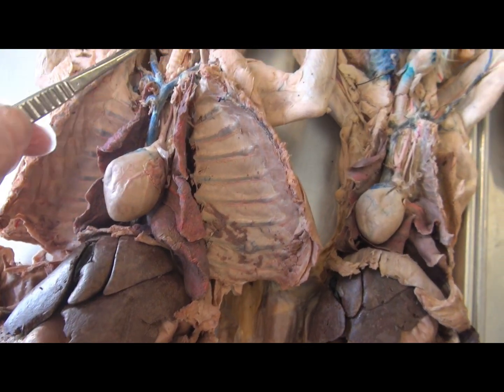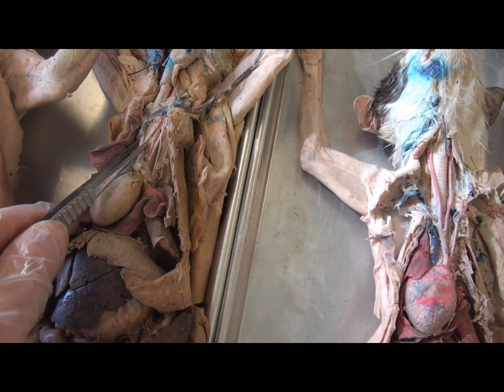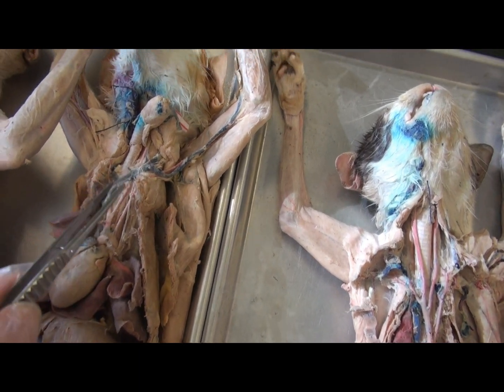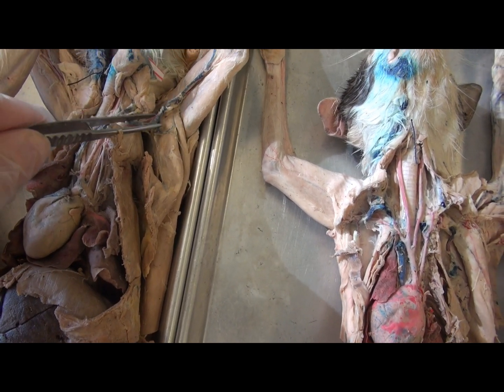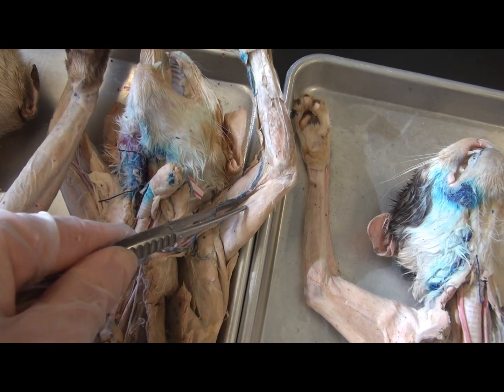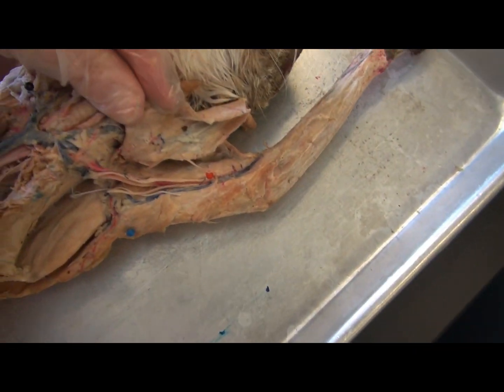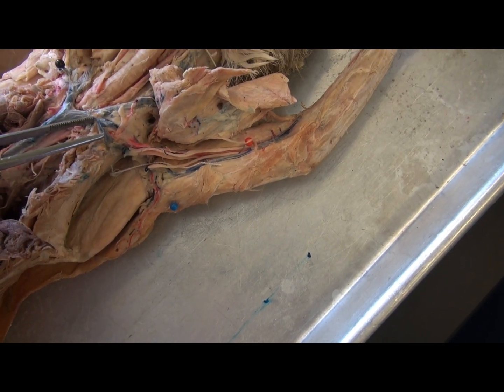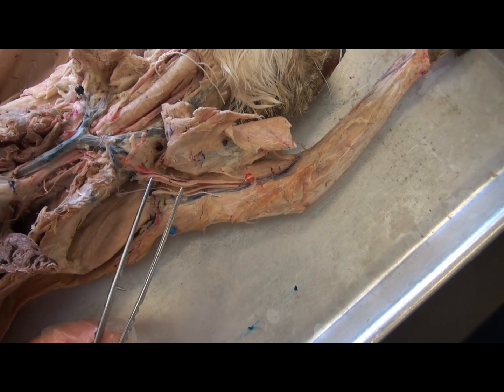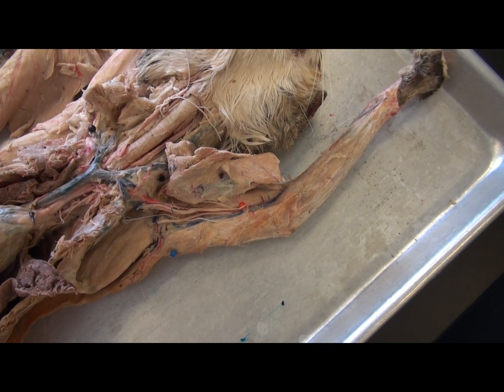There is a minor difference in the jugular between humans and cats, which I tend not to stress with my students. The subclavian then proceeds to the arm. The subclavian artery and vein in the armpit region form the axillary artery and vein, which then becomes the brachial artery and vein as it travels along the humerus. This then branches in the forearm to form the radial and ulnar artery and vein. So the short subclavian reaches the armpit to become the axillary, which becomes the brachial, and then divides further.